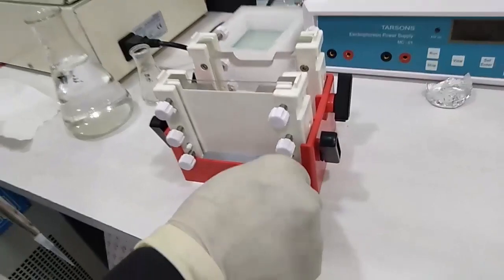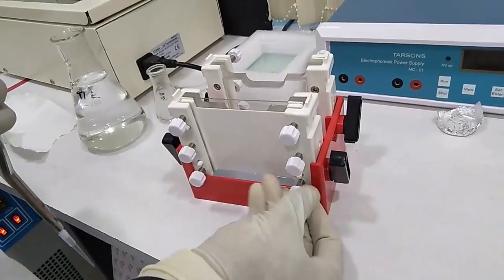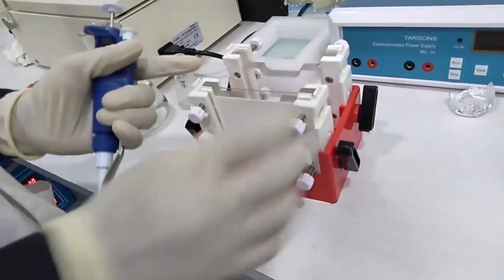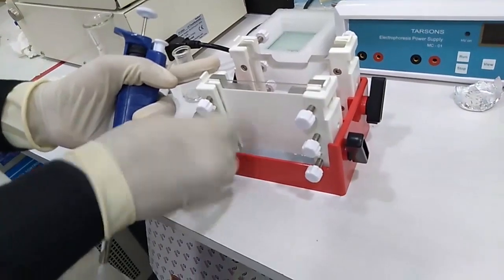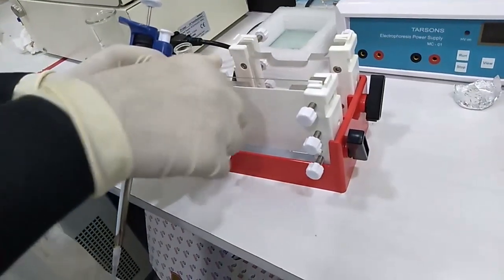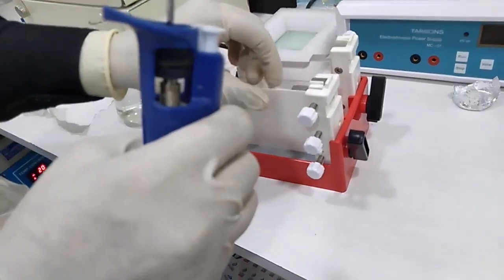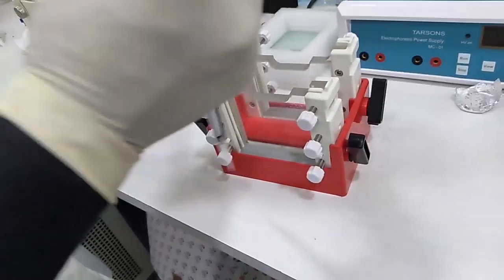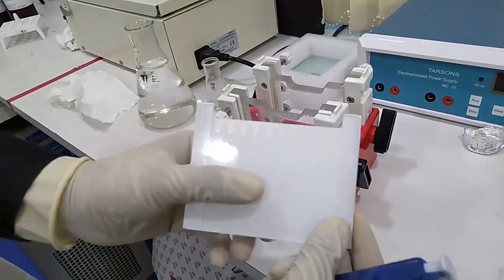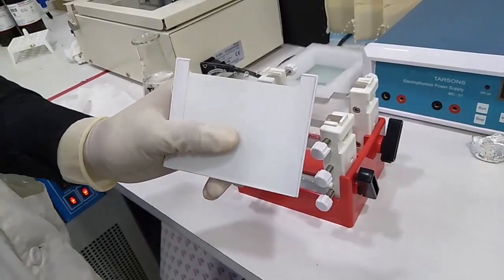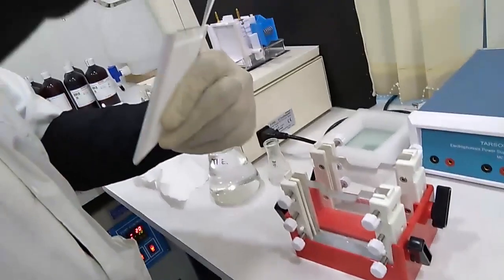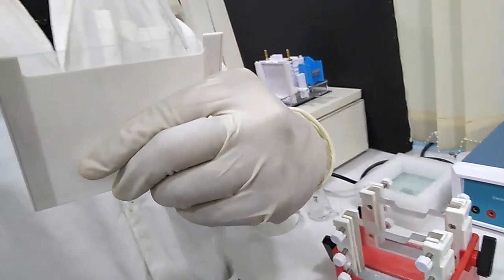Now we will remove it from the caster. The gel is already polymerized. You can see the gel, this is polymerized. Now we will remove it, we will wash it by the 1x TAE buffer.